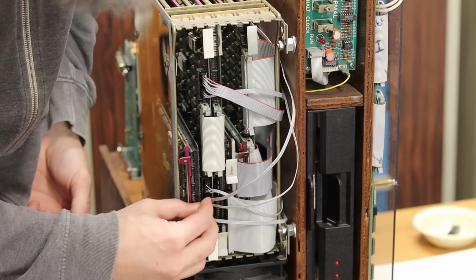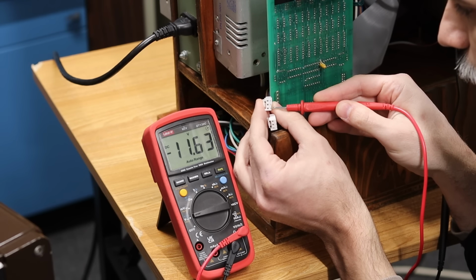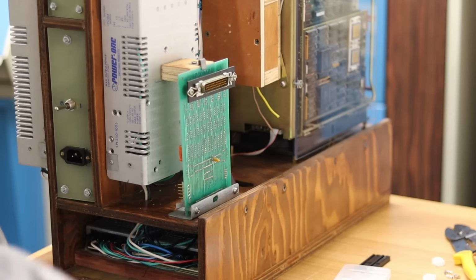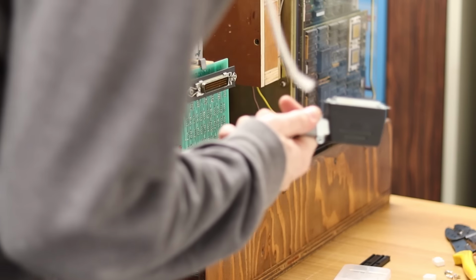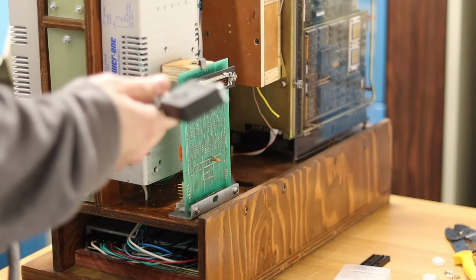Finally, before powering up the opto-isolator board, I'll double check that all my voltages look good and are in the right places, and yep, I think we're good to go. Let's plug in that 50-pin cable to connect the Bomem and oh, that's not a good sign. They're both male. I'm going to need a gender changer.